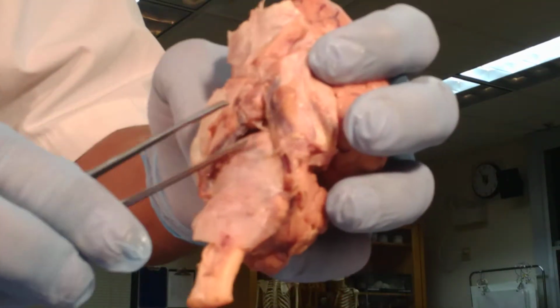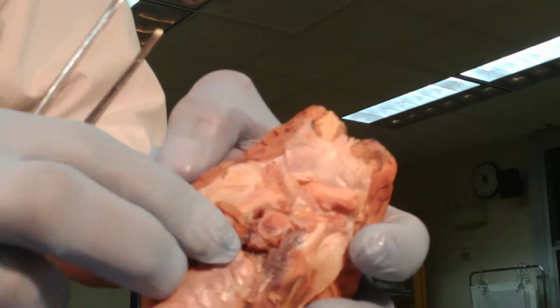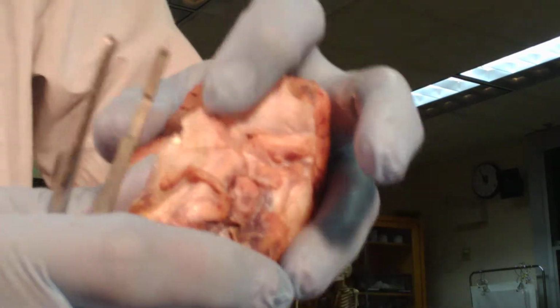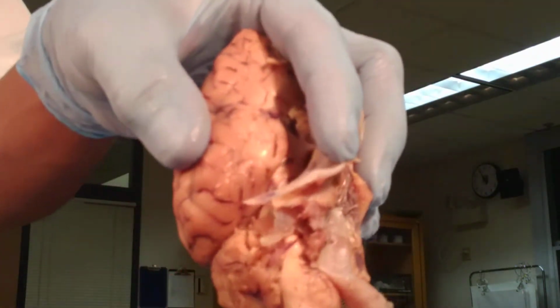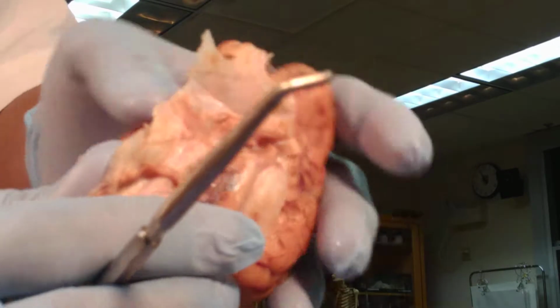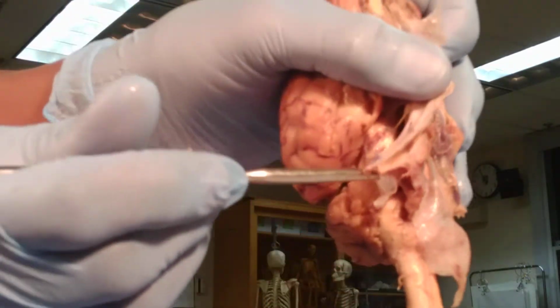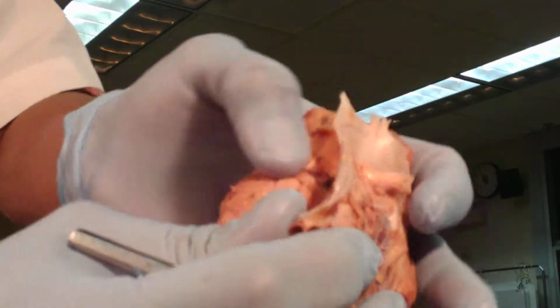So the dura mater is not removed, because when the meninges are removed all the way, the dura mater automatically will come out. If I showed you here, good news also, because we do have the dura mater, we are able to see our stalk or infundibulum that connects the pituitary gland with the hypothalamus. I'm not sure if that's obvious or not. We'll do the best we can here to have you look at it.